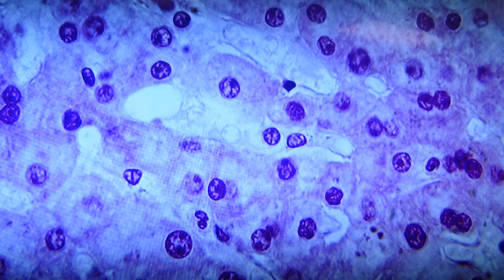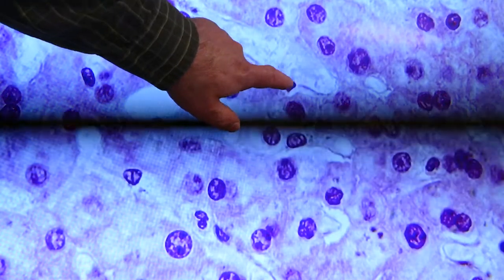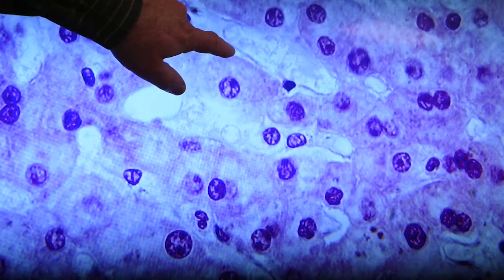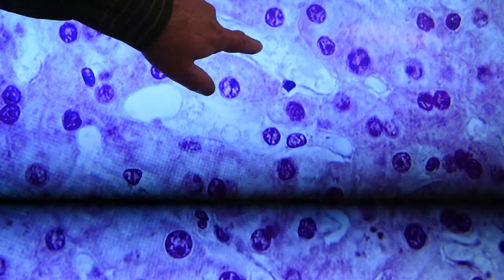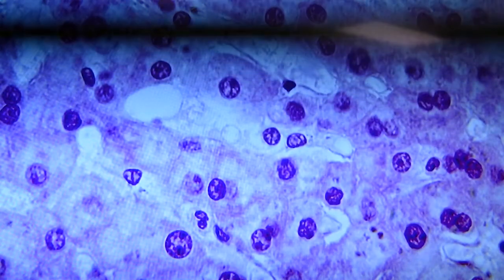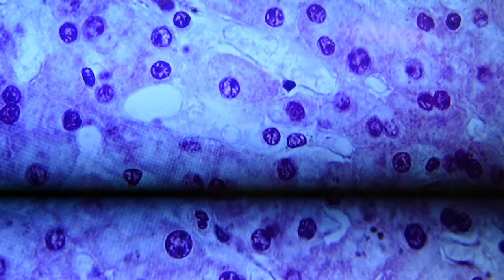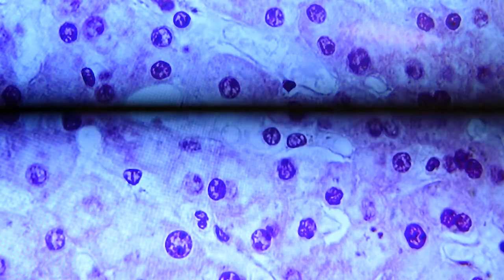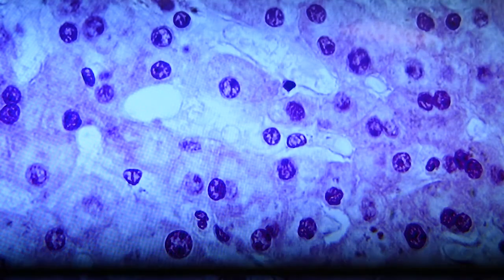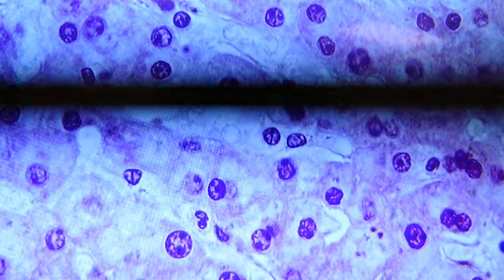Repeating the same thing over again. Here we have an endothelial nucleus right here, and a good line of that endothelial border around the sinusoidal space. There's your space of Disse outside of that, and then the Kupffer cell. This slide was labeled for Kupffer cell, but I'm not seeing one near the center of the screen, at least in this case. So we'll skip looking for that and move on to the next one.